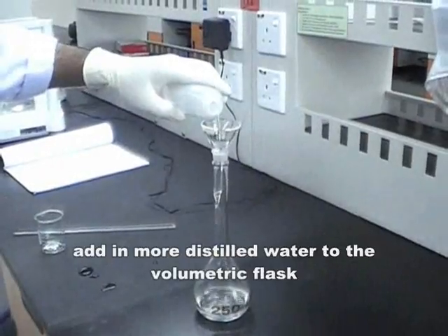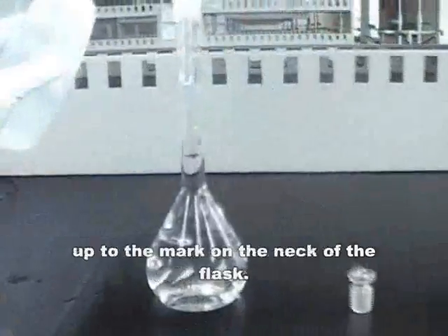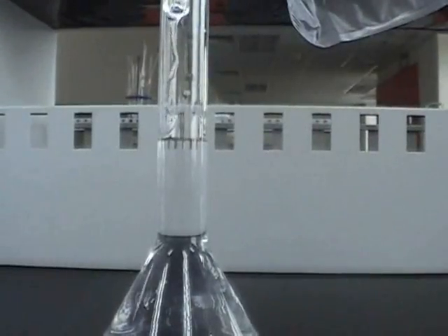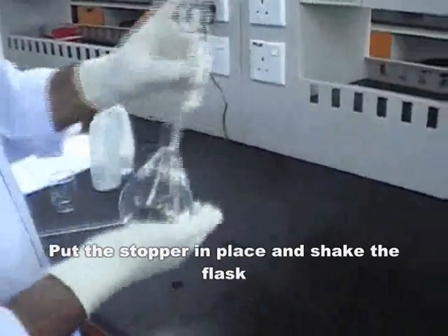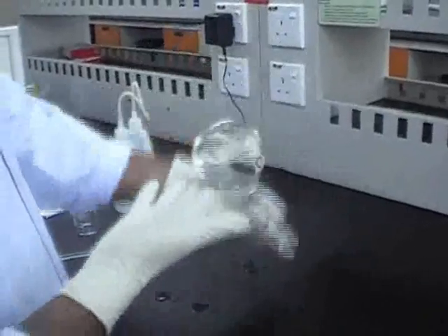Then, add in more distilled water to the volumetric flask up to the mark on the neck of the flask. Put the stopper in place and shake the flask until you get a homogeneous solution.